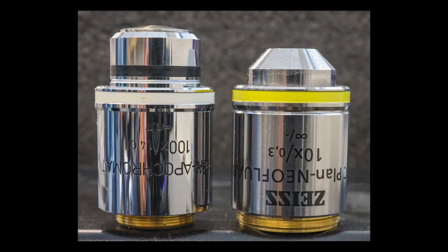We would like to set up a microscope for standard bright field imaging. The first thing we need to decide is what microscope objective we are going to use in a particular experiment. Here are two objectives made by Zeiss. They are shown in the orientation in which they would be used in an inverted microscope.